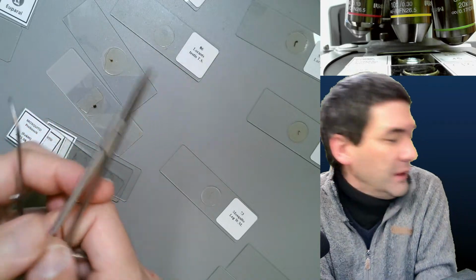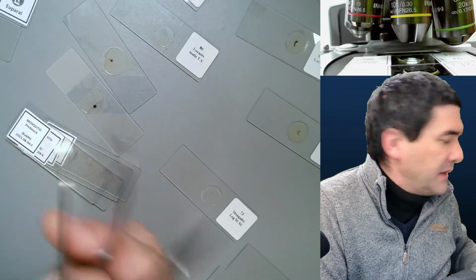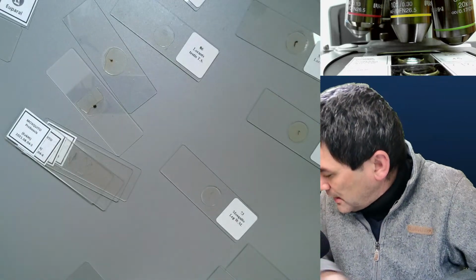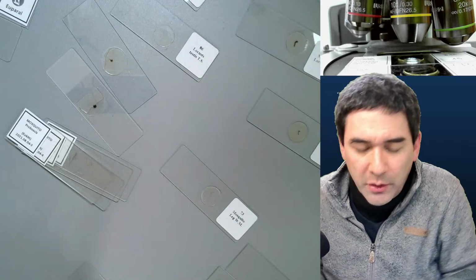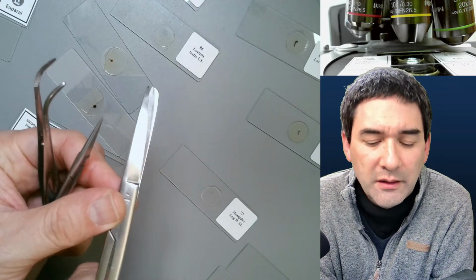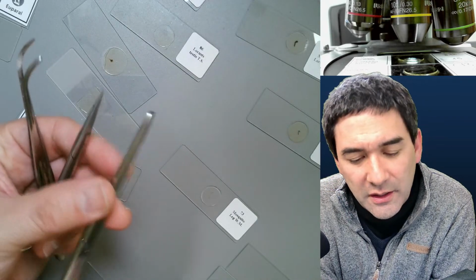So that is where I'm just looking around for. So this is something I can recommend. For tools, I also recommend, if you want to cut apart slightly larger objects, plant specimens or so, of course, you might want to use slightly more solid scissors here.